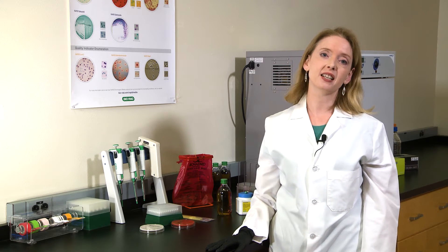Now before we start let's make sure the plates are dry and of course we always follow good laboratory practice. So let's begin with rapid salmonella agar. The protocol used to streak these plates is the same for all of our other rapid chromogenic media with the exception of the listeria agars.